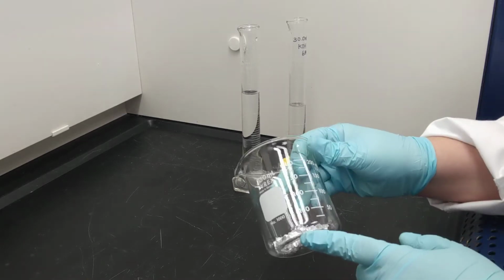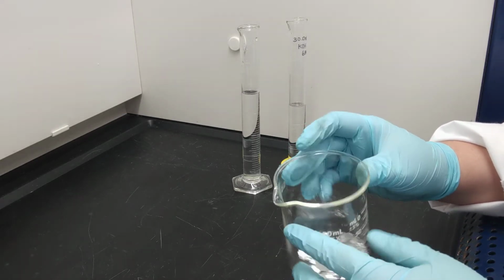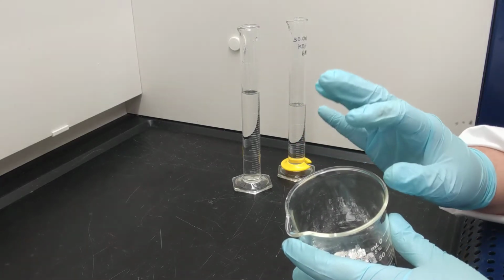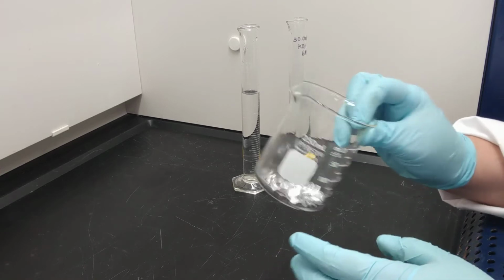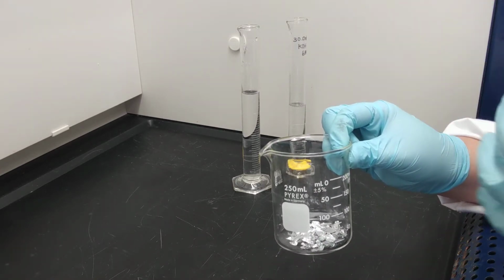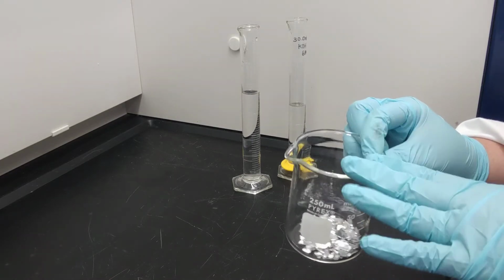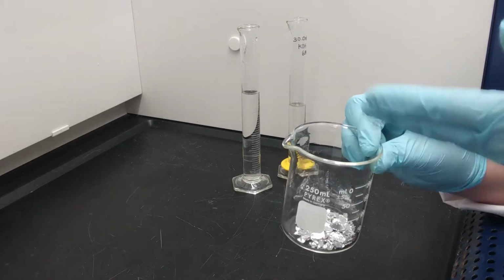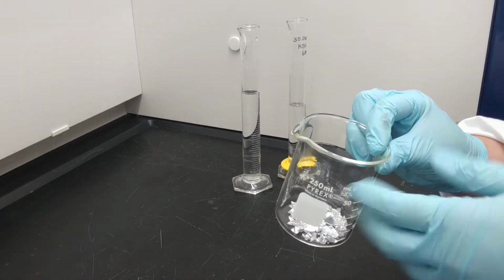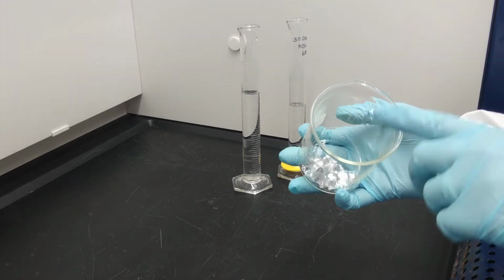So you have a beaker that you have determined the mass of, and then you're going to add about 1 gram of aluminum, but you have to make sure that you copy the exact amount that you're using. The goal of this experiment is to actually calculate the percent yield that we're getting, based on the amount of product, and the amount of product that we're getting is going to depend on how much of this reactant aluminum we're using.